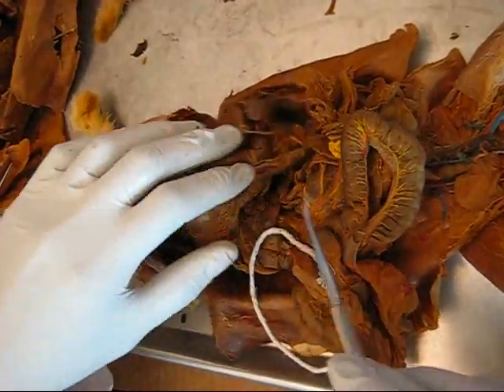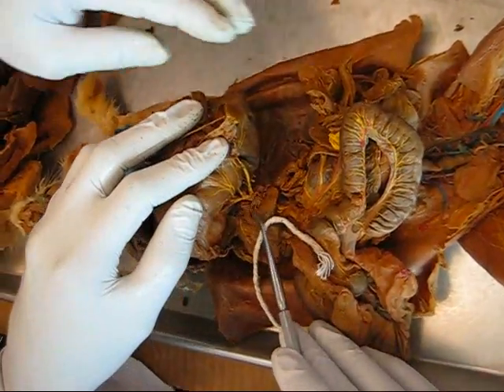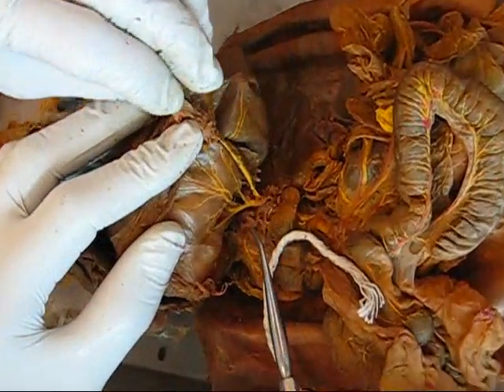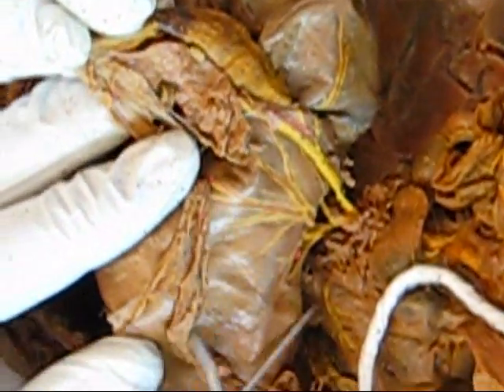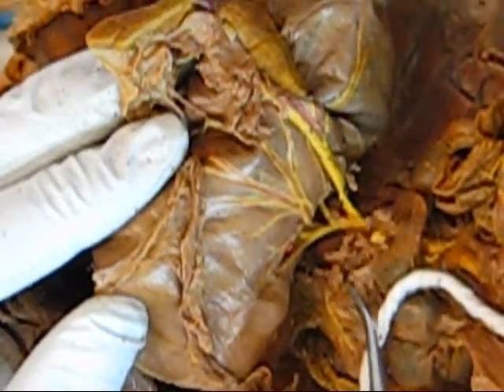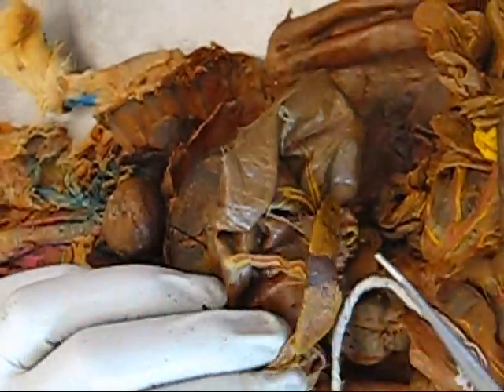Pancreas — this glandular tissue under the stomach. All of this here — though part of it is ripped. Spleen — this is the spleen.